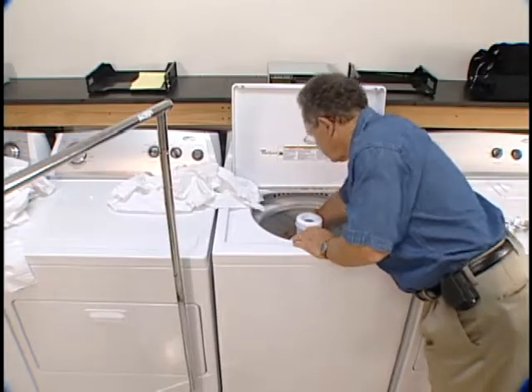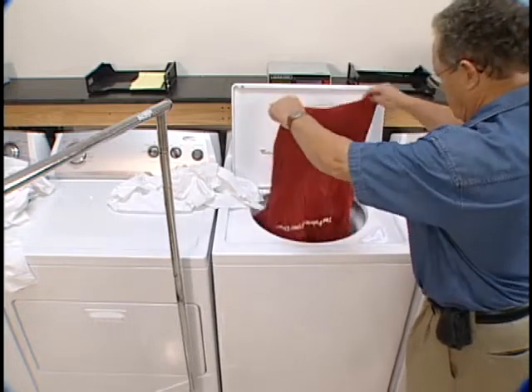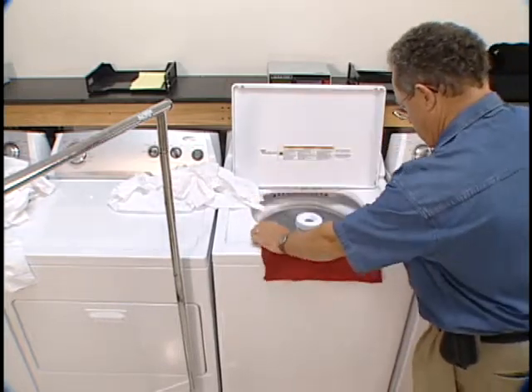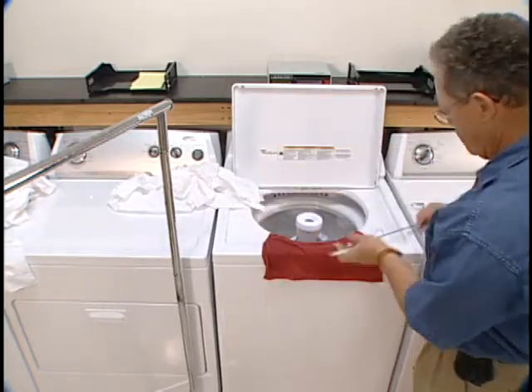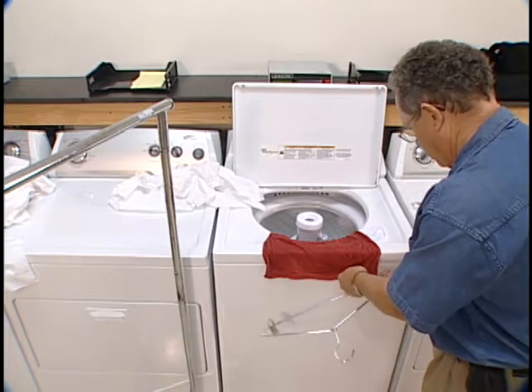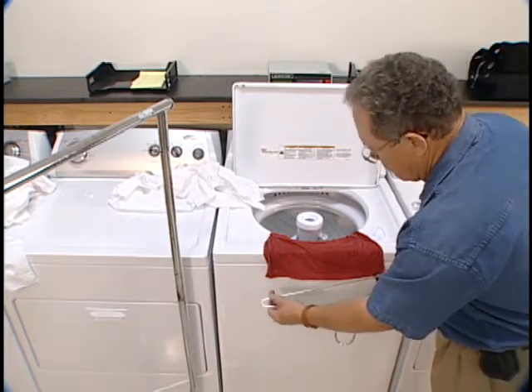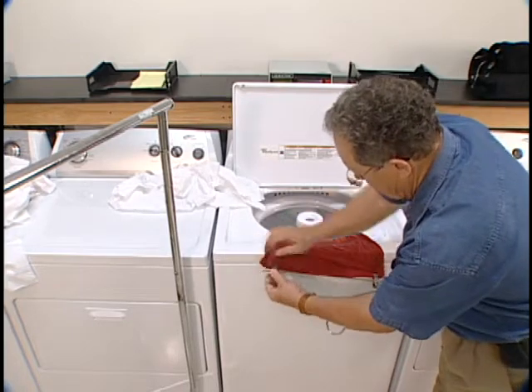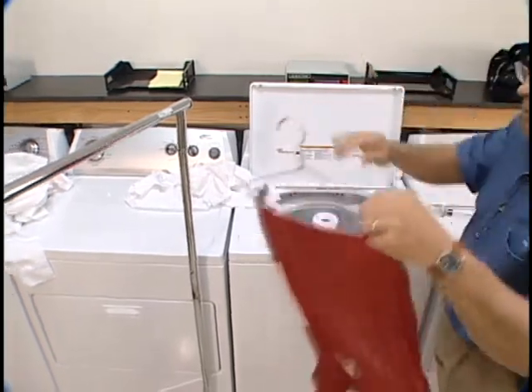When line drying is chosen, the specimens are carefully removed from the washer after the final spin cycle and hung for drying. Hang each fabric specimen by two corners with the fabric length in the vertical direction. Allow specimens to hang in still air at room temperature until dry.